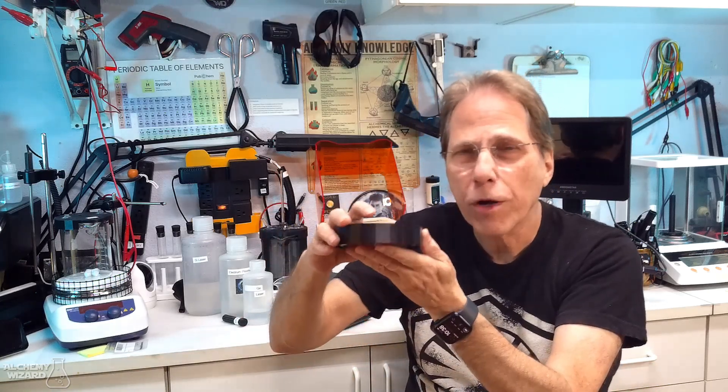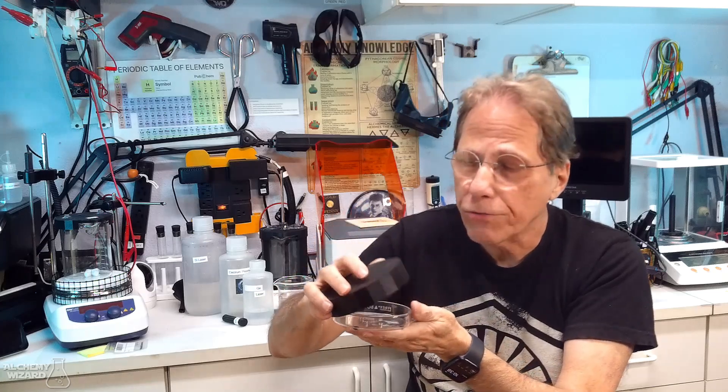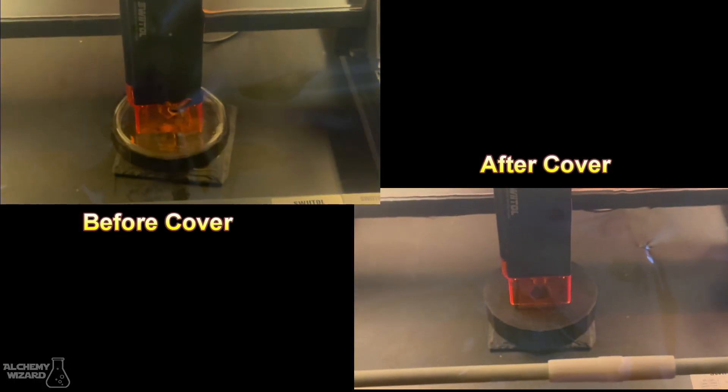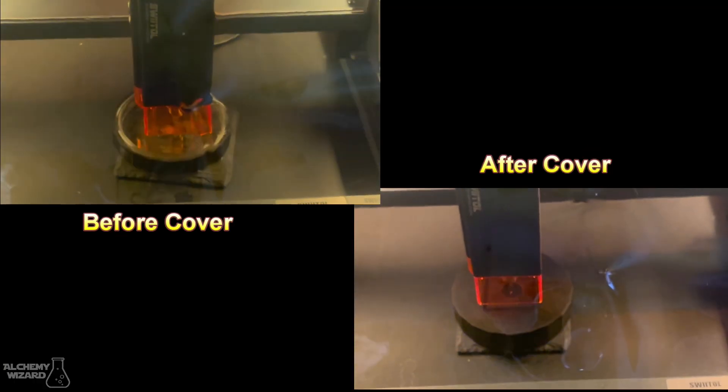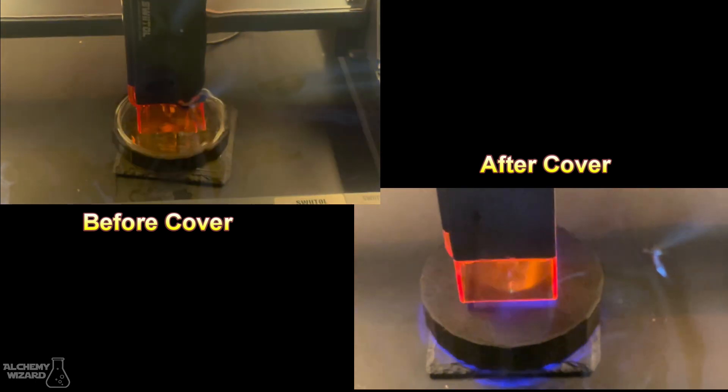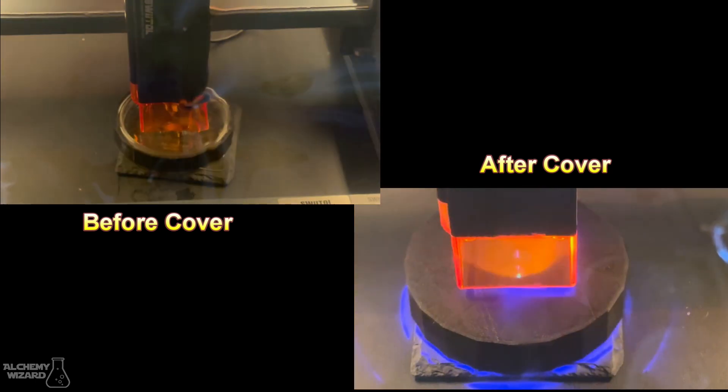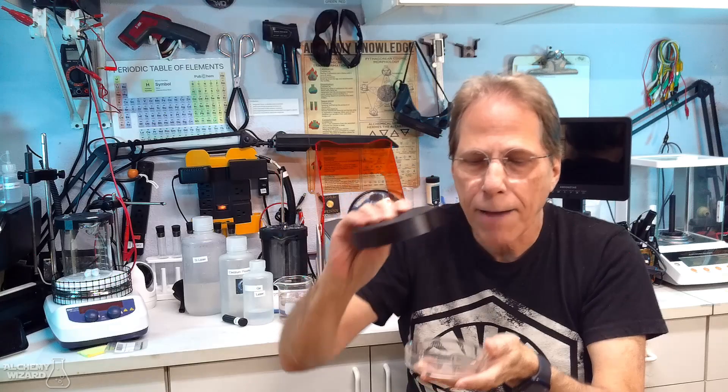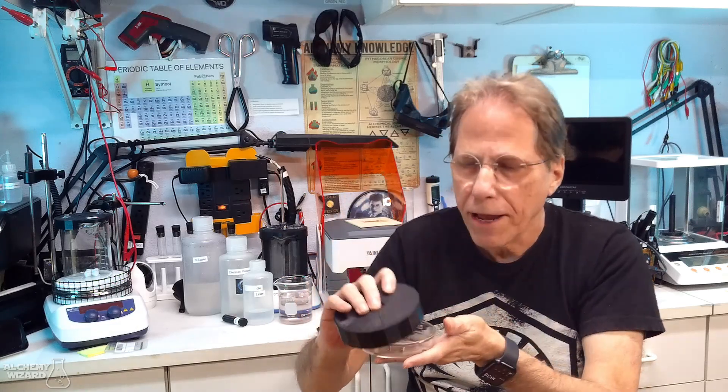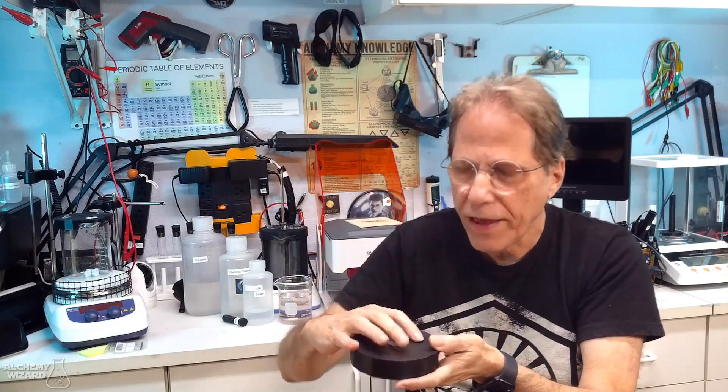Now if you didn't want to print the 3D cover, what can you do? Very simply, all you really have to do is cover this dish with duct tape, preferably black duct tape, to prevent the laser light from escaping. Just cover the top, cover the sides, and you're set right then and there.